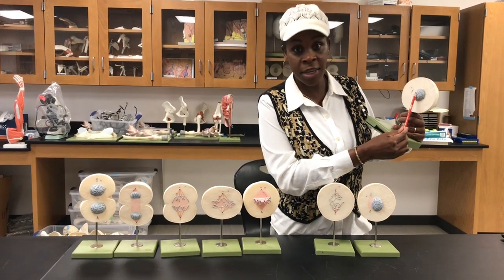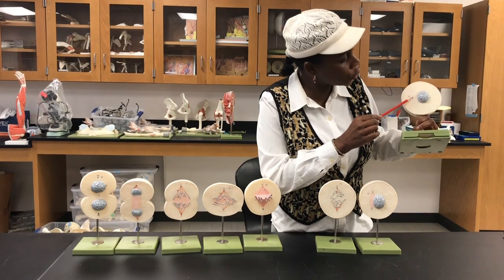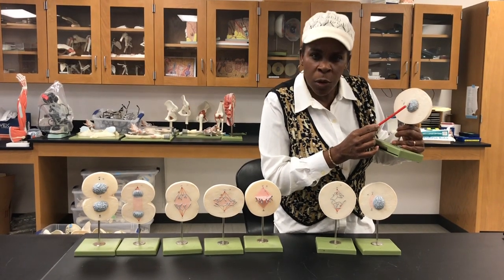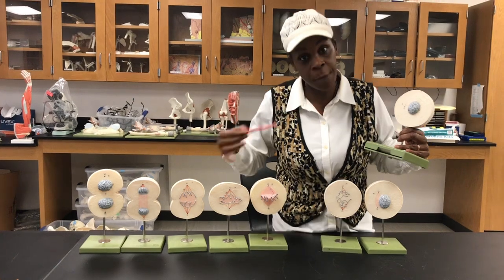What you can see, it looks like a regular cell. The nucleus is here, and you see the centriole. But what you're gonna notice is the centrioles are a little bit more visible. You can see the two dots here. The cell, you can see the chromosomes are kind of very visible, right? They don't look like chromatin, but they start to look like a chromosome, which is the shape of chromatin.